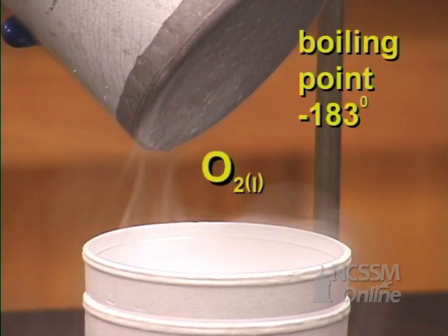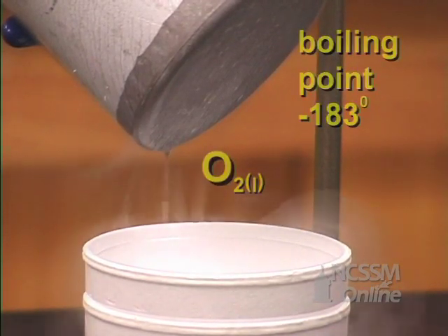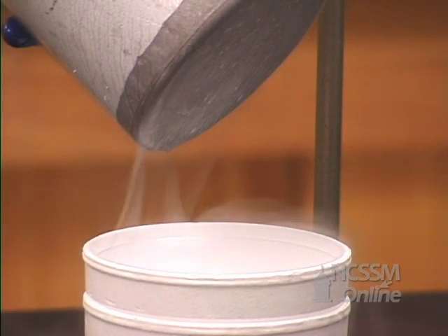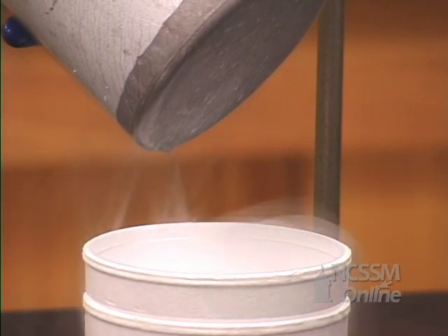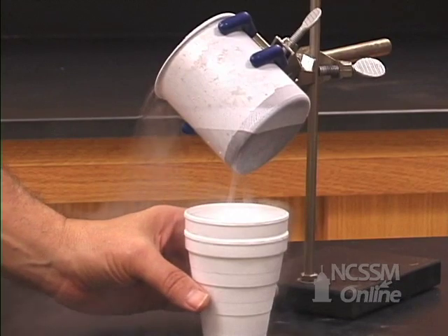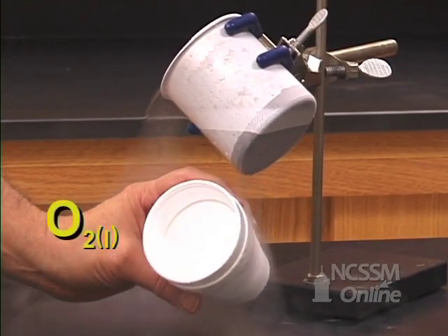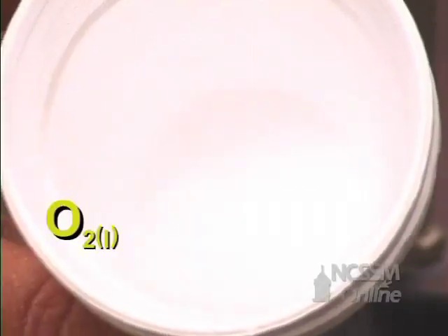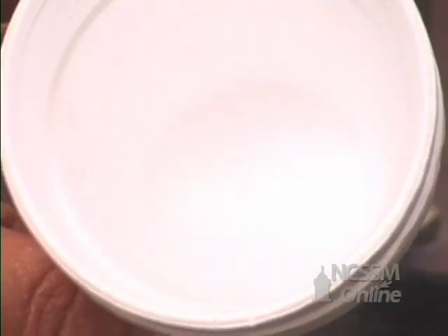We add liquid nitrogen to the metal cup. The cup cools down to minus 196 degrees Celsius. The oxygen condenses from the air and drips off the bottom of the metal cup. We collect that in the Styrofoam cup.